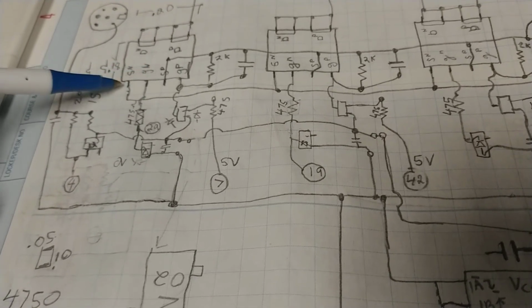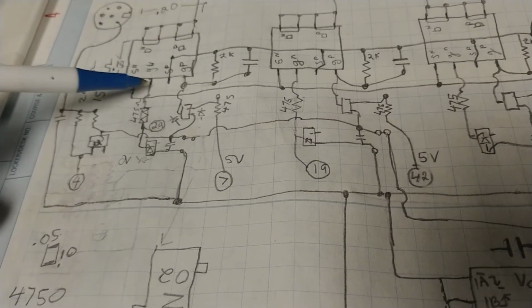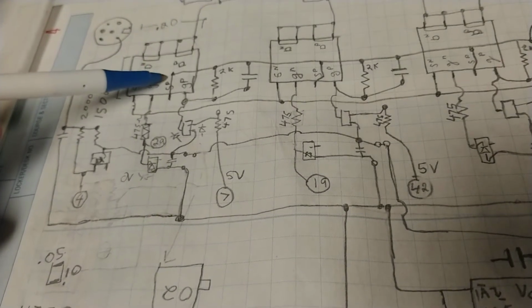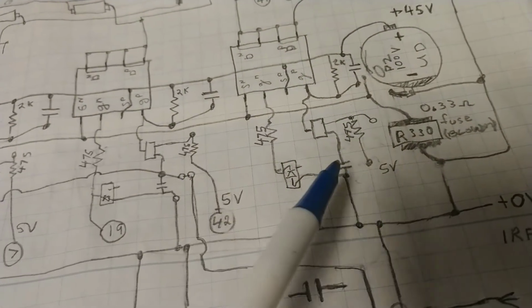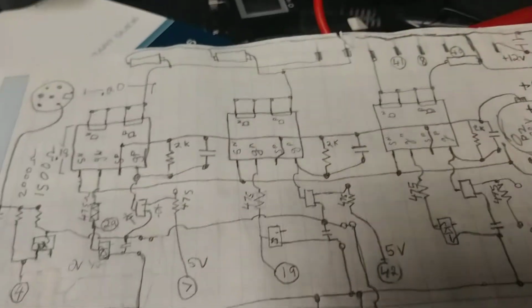Also, the resistance between the gate and the source was 0 ohms. So this little fella is blown. Got to replace that, and that. And hopefully I'll get me a working hot plate.